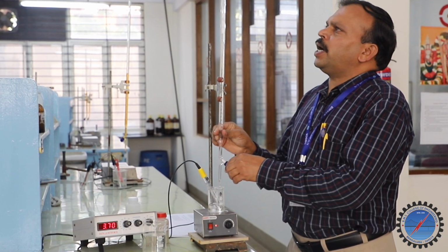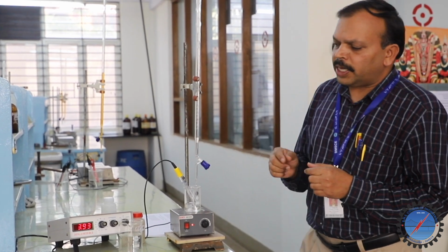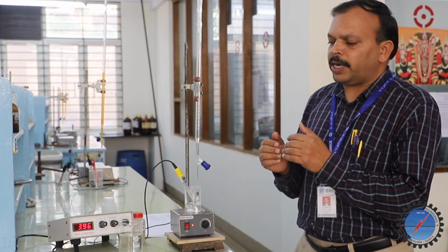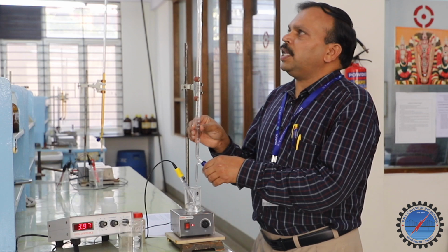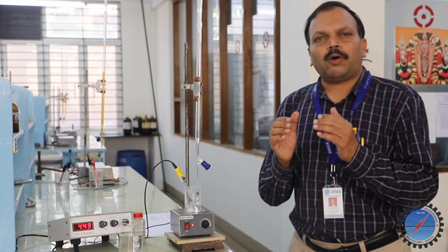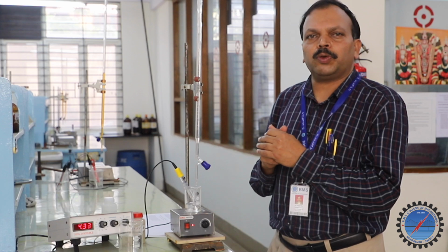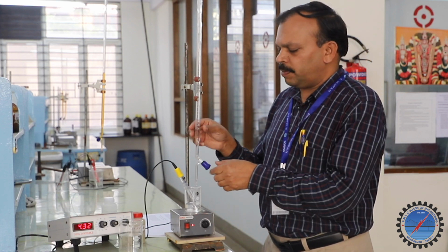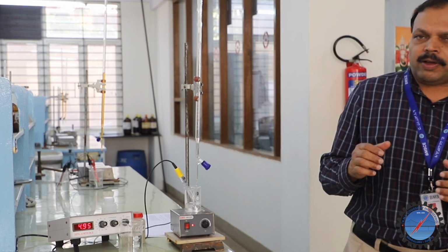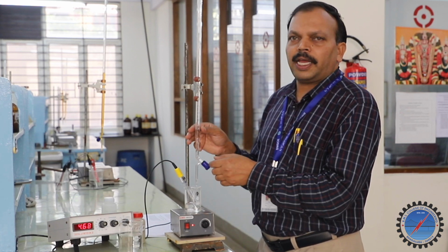So now I am going to add another 0.5. See, like this, if I keep on adding 0.5, I am going to record the variation in the pH value. So now the pH value goes to 3.97. Every addition of 0.5 ml of NaOH from the burette keeps increasing the pH value. It goes to 4.33. You can read that. Another 0.5 I am going to add. The pH value goes from 4.3 something to 4.68.